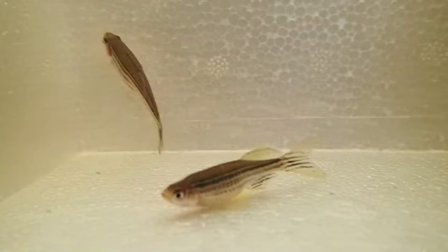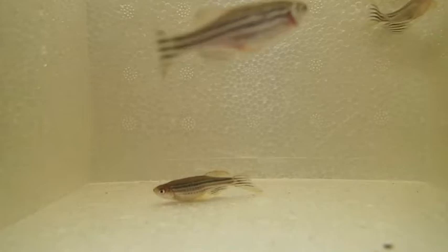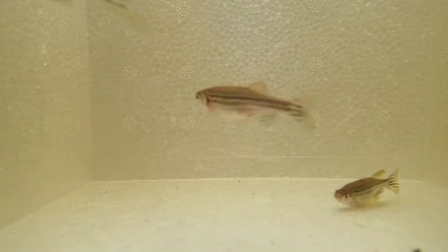For small fish it's okay to let them swim freely, but if you are doing surgery on a fish and your client is watching, at this stage it's advisable to keep your hand on the fish. Sometimes the fish waking up and looking a little groggy, swimming around, might cause the client some distress.